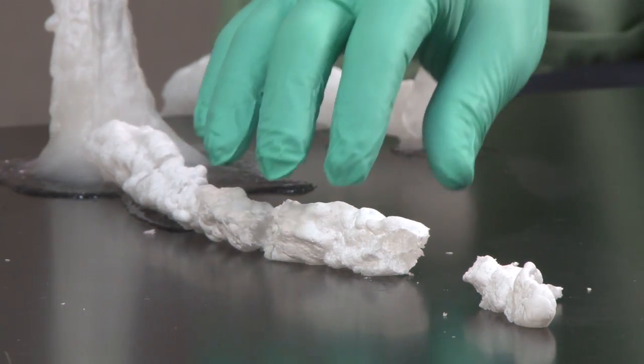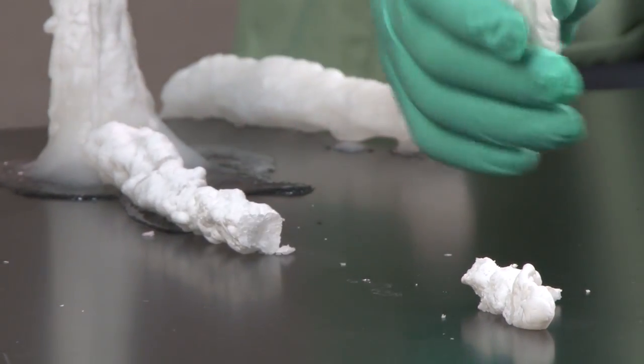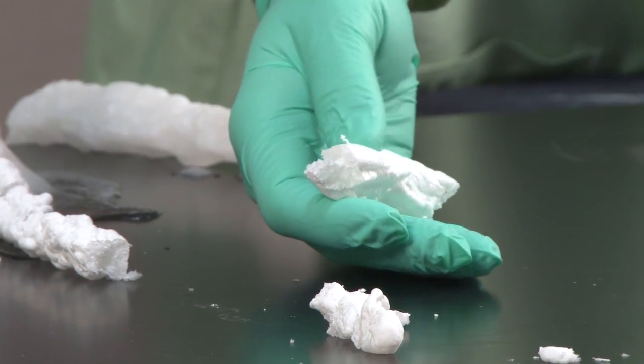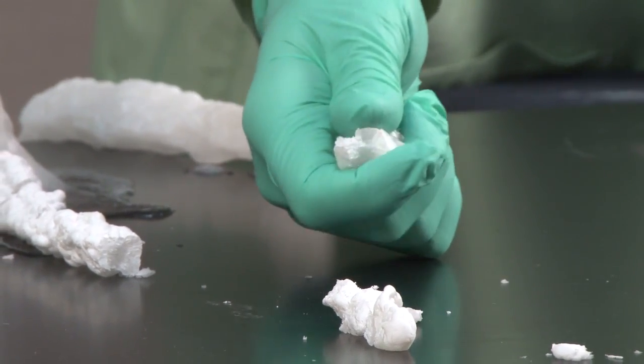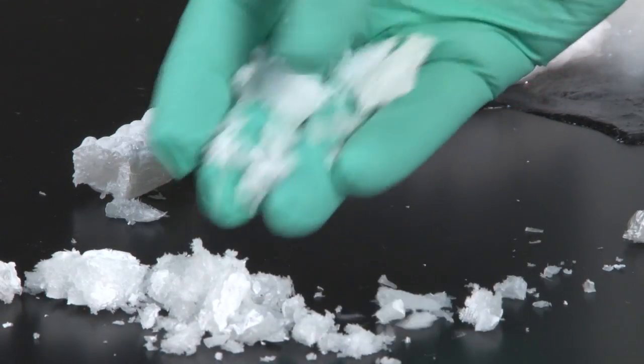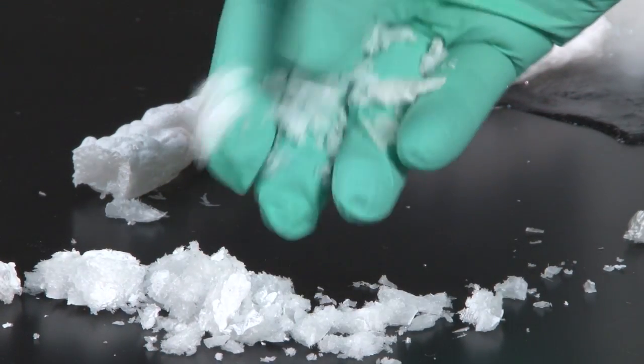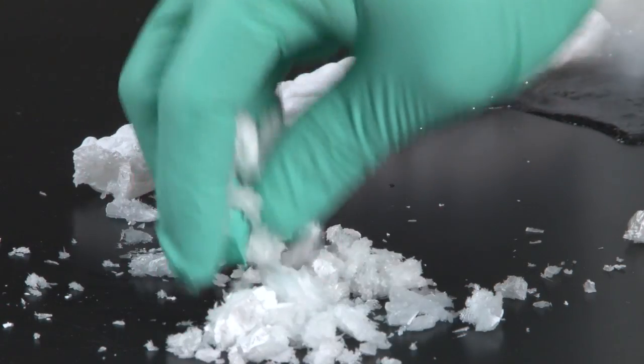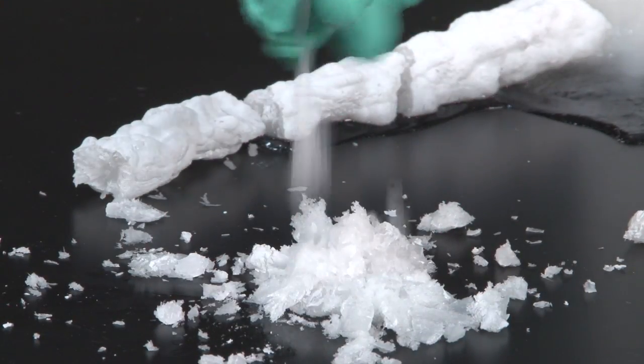So I'm going to show you this is the column that fell down a little while ago. This is a piece of our column. I'm going to just gently crush it with my hand. You can see it's kind of a brittle solid. I could just crumble it into this powder of the trihydrate.